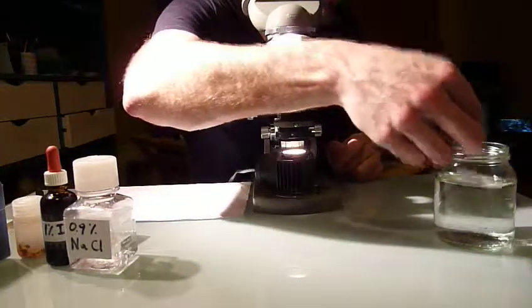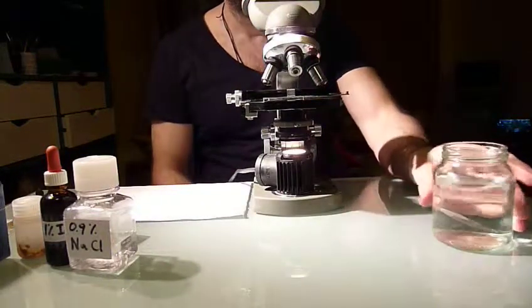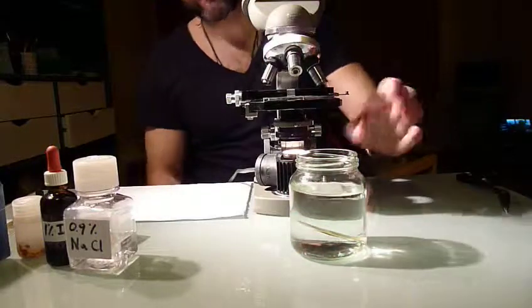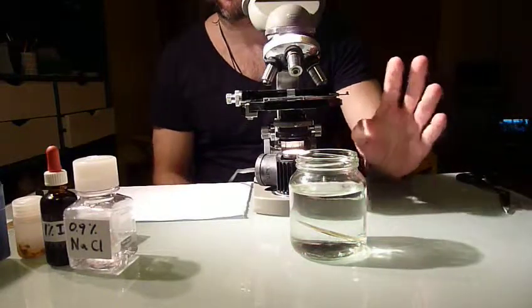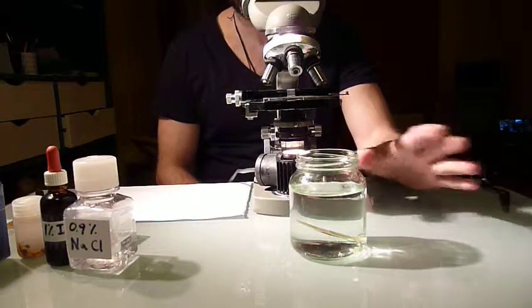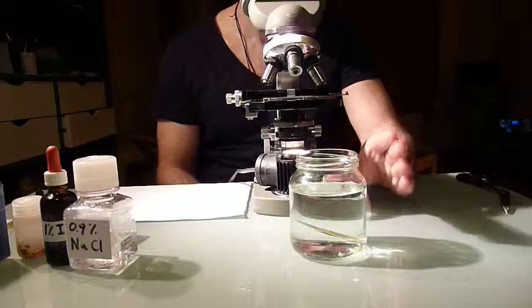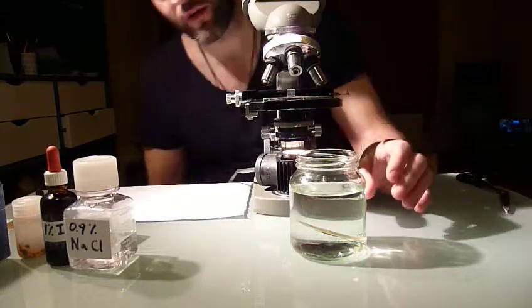And then you just pop the sample in the chlorinated water, and just allow it to sit there for like 30 minutes. Then everything in there should be dead, all the bacteria, all the cysts that may have been there, they should be dead within 30 minutes.